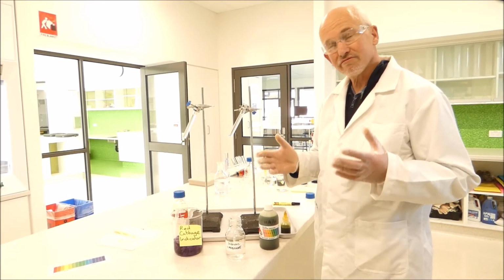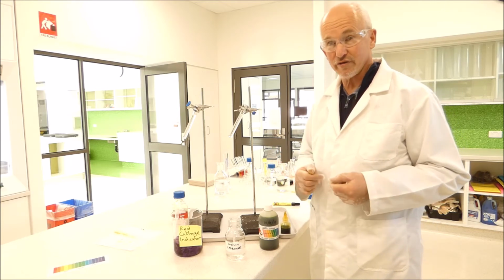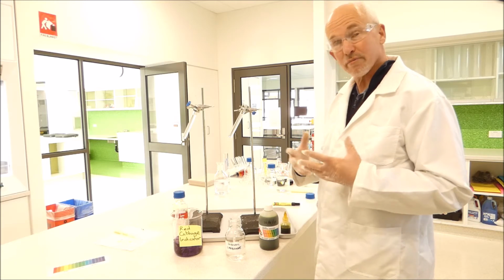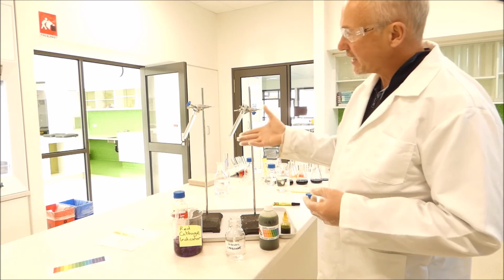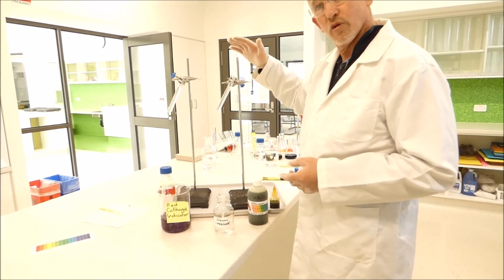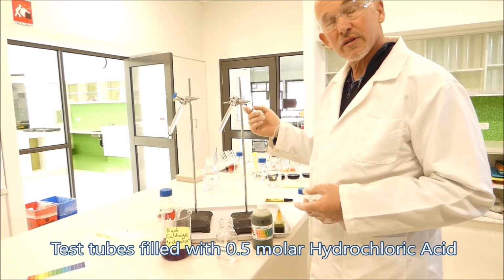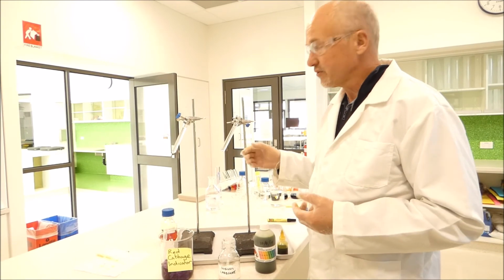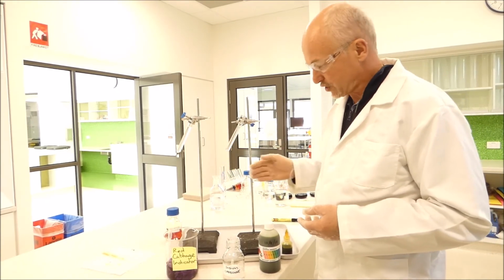Okay, so a really fun, interesting experiment to demonstrate the range of colours you get from universal indicator, and we're going to try it on red cabbage indicator as well, is the Rainbow Fizz experiment. For the Rainbow Fizz experiment, we get a couple of test tubes. We're going to have one for red cabbage on this side, one for universal indicator on this side. What we do, we fill the test tube up with 0.5 molar hydrochloric acid, so nice and acidic. We go to about 2/3 full on each tube.